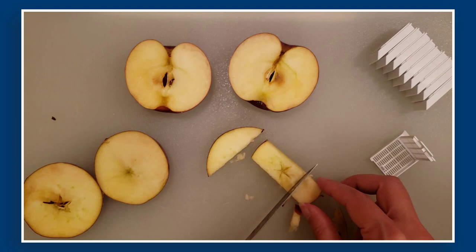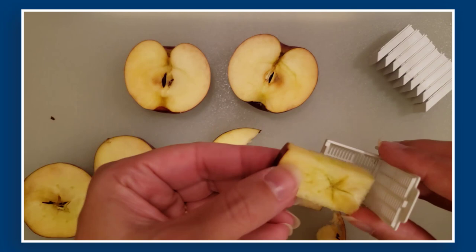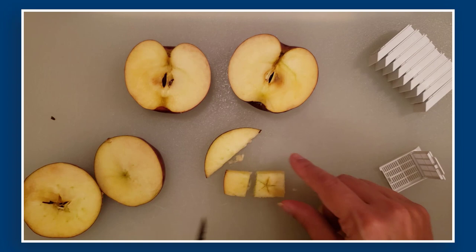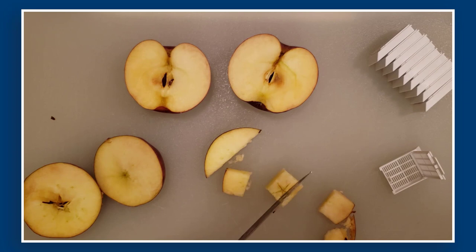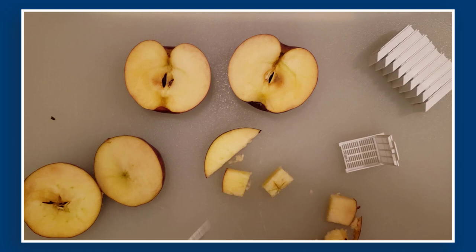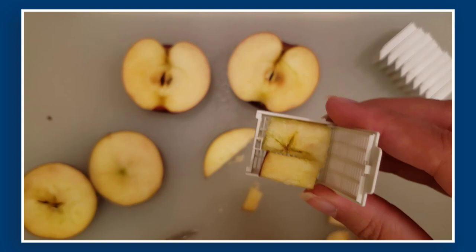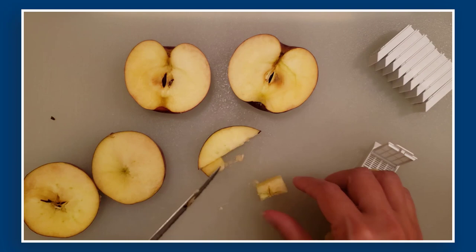If I want to see this whole representation, it does not fit in this cassette, so what can I do? We can always bisect it and take this area here. Maybe I don't need to see the whole star shape because I want to fit everything in one of these cassettes, so I'll take an area like that and like that — we can actually put both of these into the cassette. That's going to be a little tight, so I'm going to trim it down a little bit more.